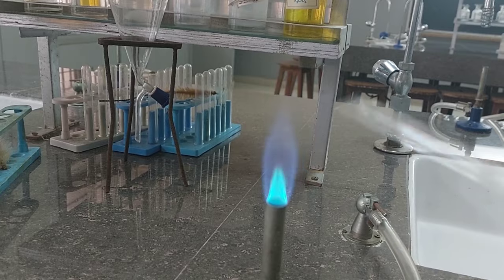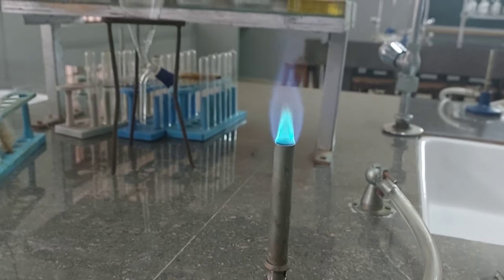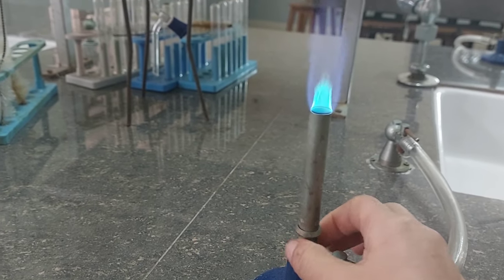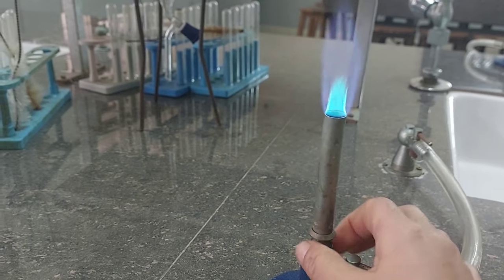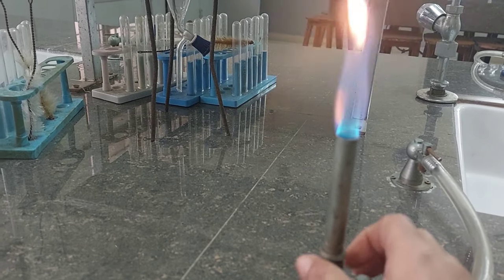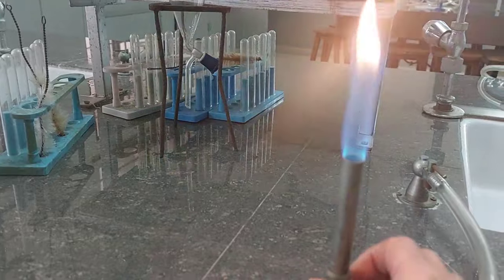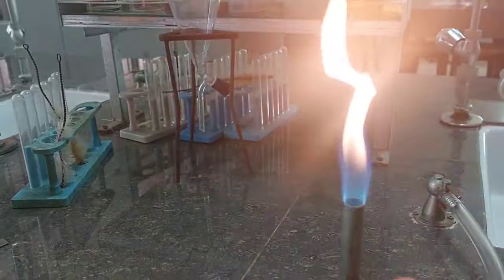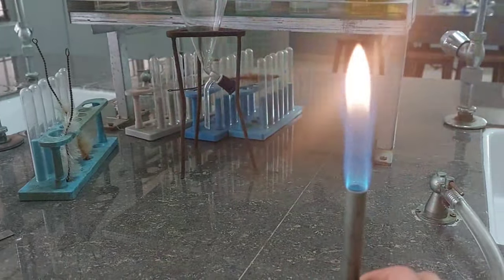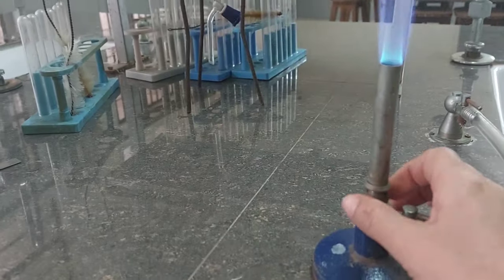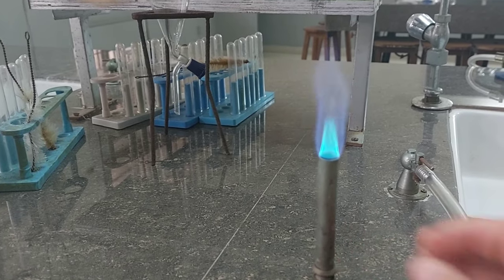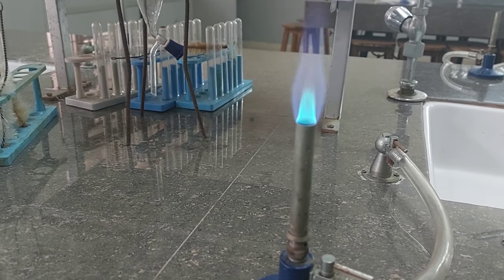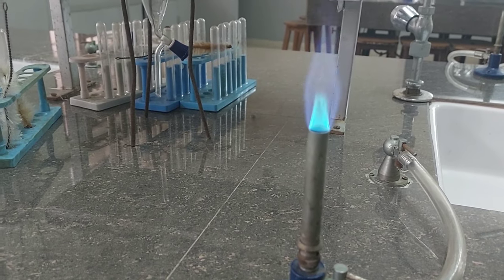Just remember, what is the difference between a luminous and a non-luminous flame? Luminous means luminosity. Whenever there is unburnt carbon or excess of carbon in the fuel or not enough oxygen, like you can see in this case I have closed the nozzle so we don't have enough oxygen, the unburnt carbon tends to glow with red heat and hence appears yellow. So yellow flame, luminous flame, luminosity means color.